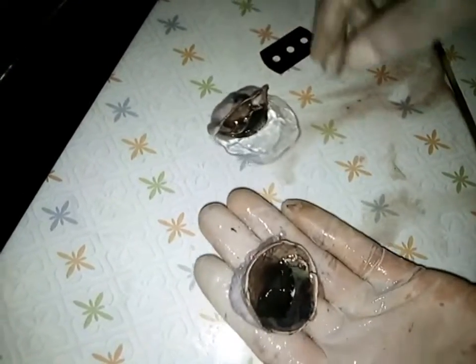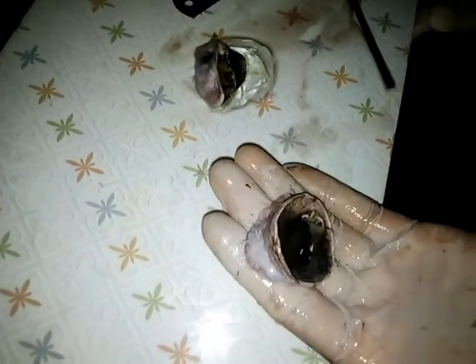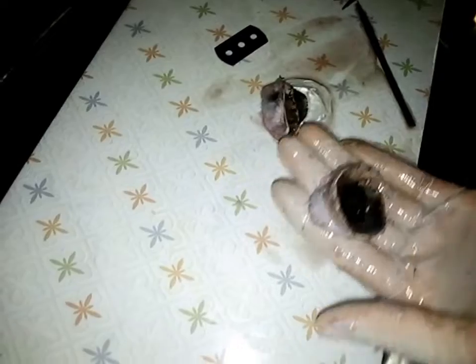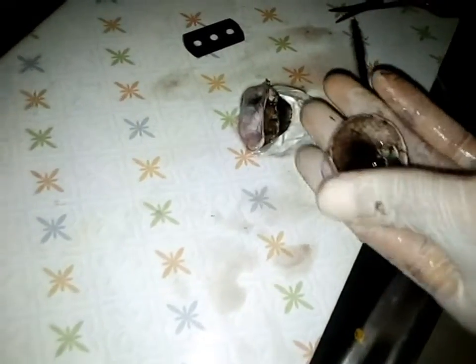I took a hand sanitizer to color it. So what's the work of that thing now? Just to give the eye a shape. No wonder. So beautiful, I could eat.